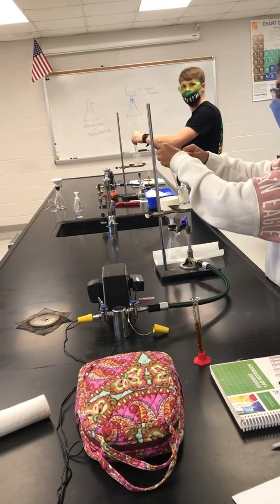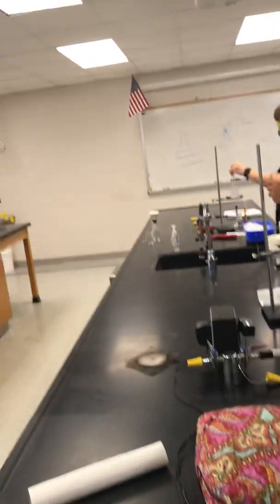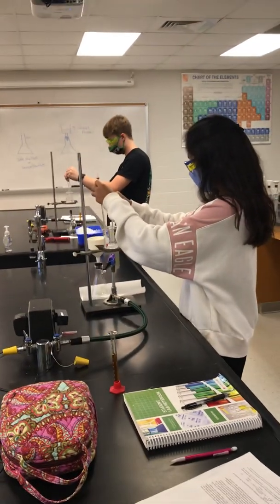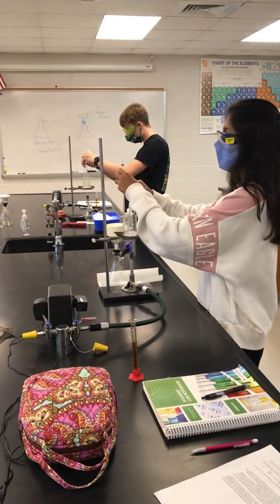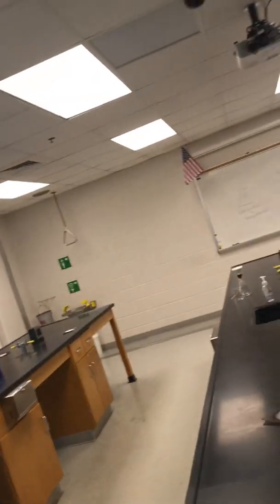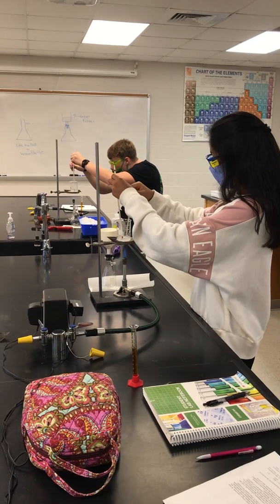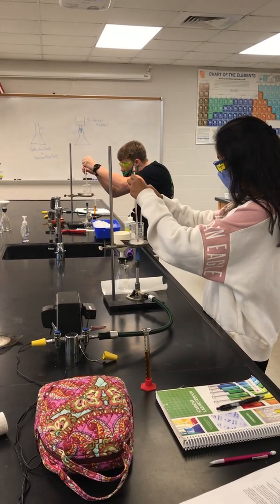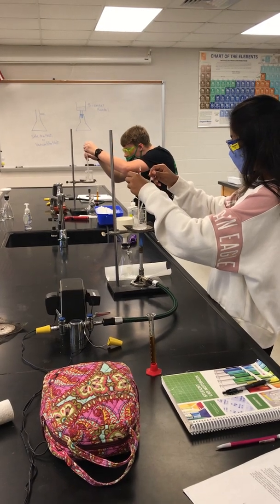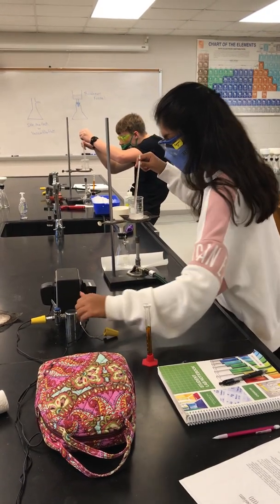We should have aprons on. I'm at 70 — come on. Okay, I'm at 80. Turn your heat off then. Just turn the gas off right there and keep stirring. Stir, because you're actually boiling.